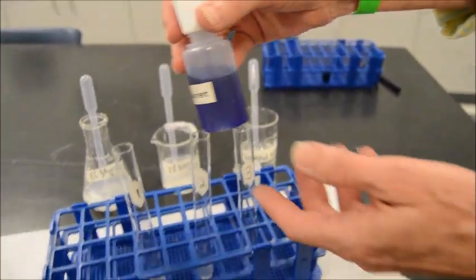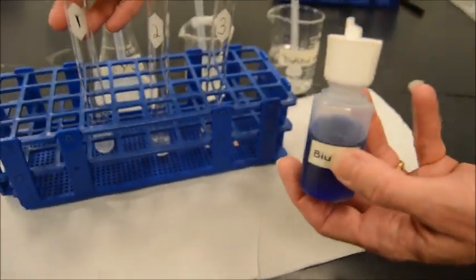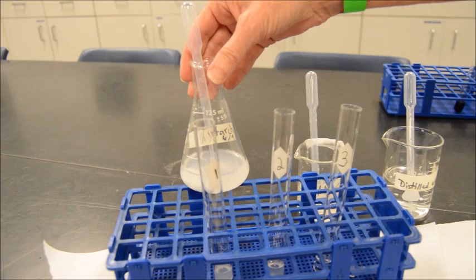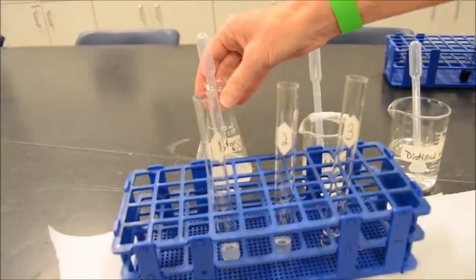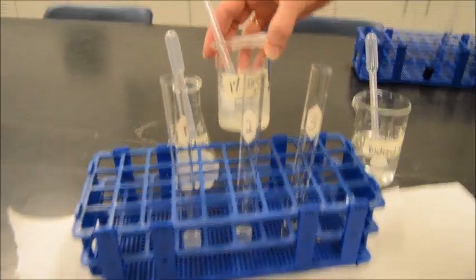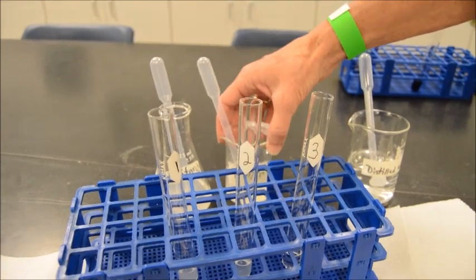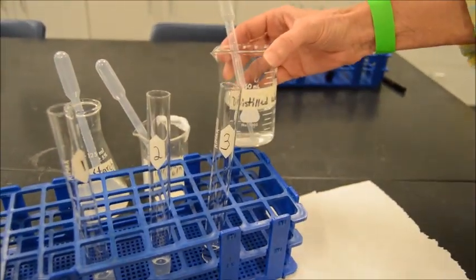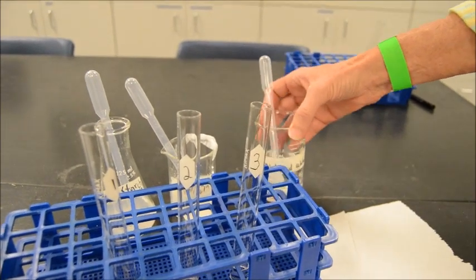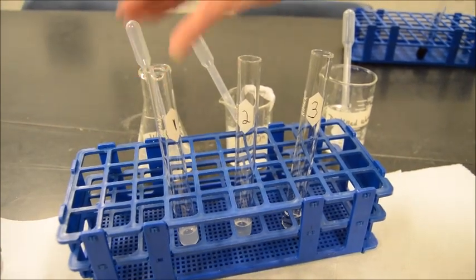So we're going to do these drops. Let's put them over white so we can really see it. All right, so what we have, number 1, here's our starch. Now recall, starch is a polysaccharide, so we're not expecting to see anything. This could be considered a negative control in the grand scheme. And then number 2 is albumin, egg white. Indeed, protein rich. And then, of course, good old-fashioned distilled water, guaranteed nothing in it. That's really your hardcore negative control. So even though you know a little bit more about starch, technically that's your test sample today.